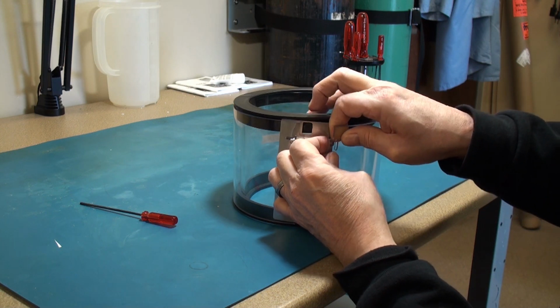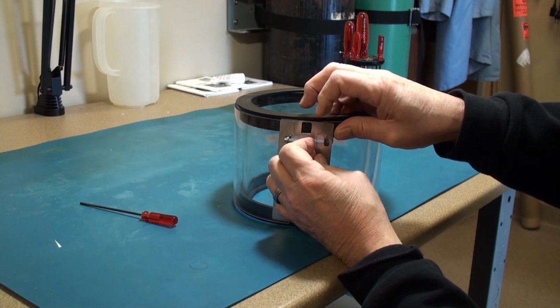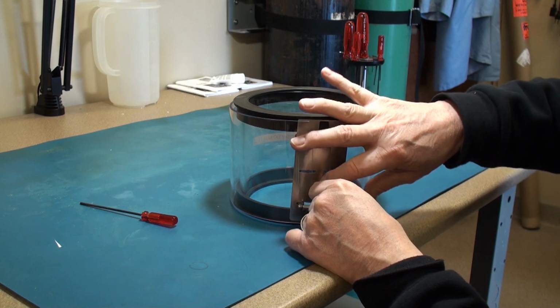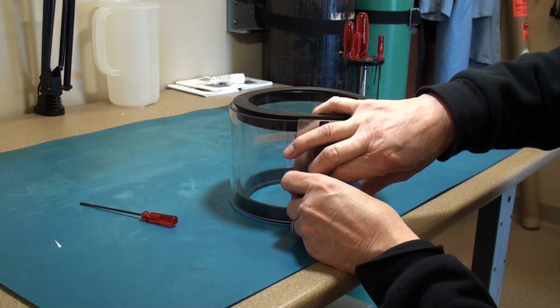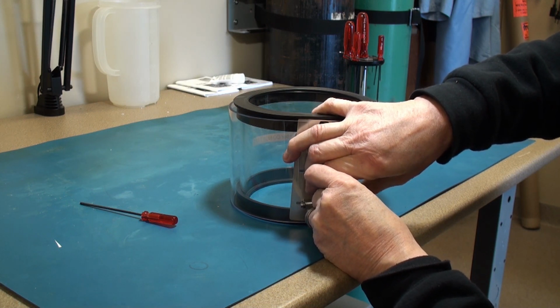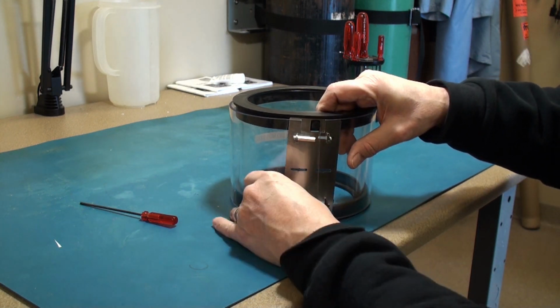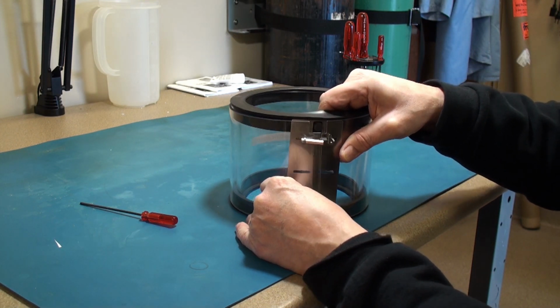Believe me, folks, there's no real simplified method to do this. You just sort of have to play with it. And after a minute or so, you have them back in place.